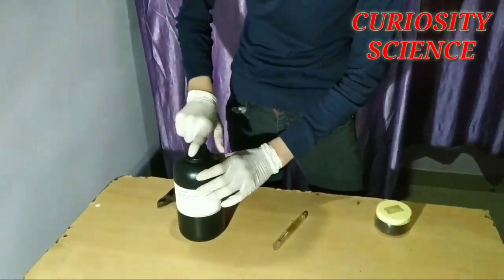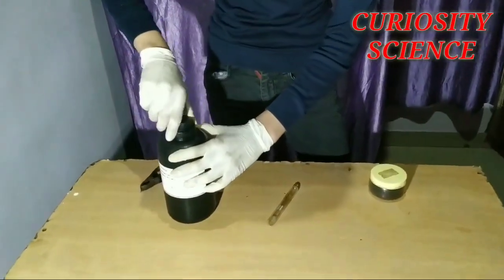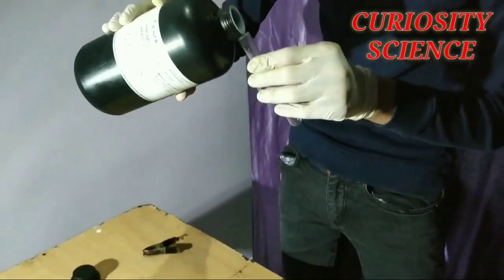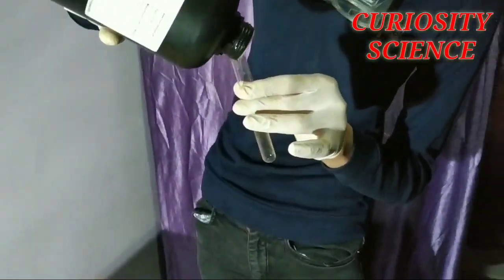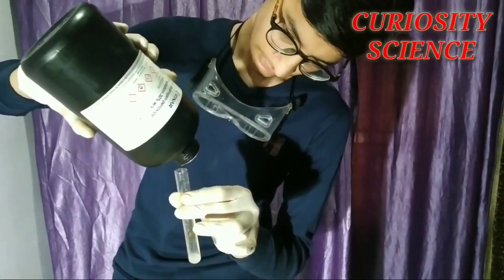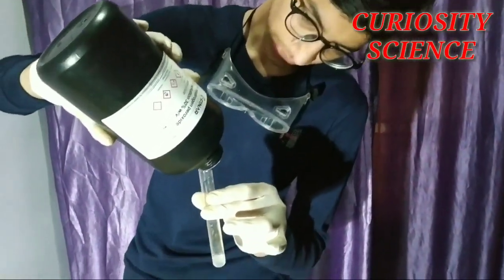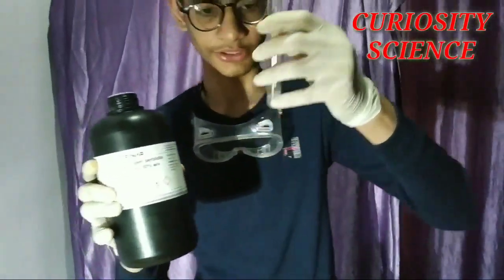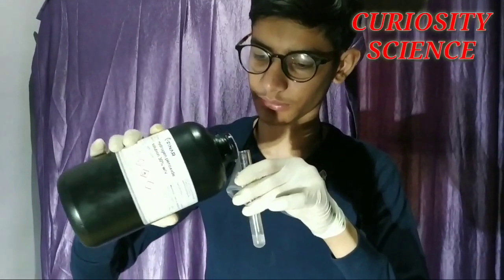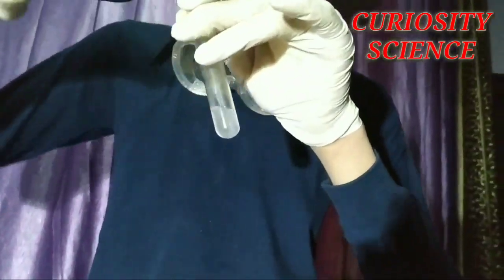First of all we are going to take the hydrogen peroxide. We will add hydrogen peroxide in this test tube — just a little bit, because it will be a very dangerous reaction. We need to be careful with hydrogen peroxide because it can damage the skin; it is very concentrated at 30%.